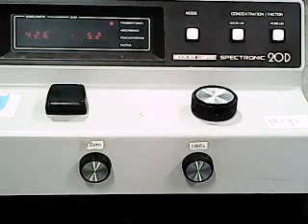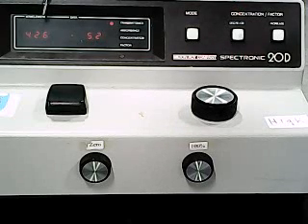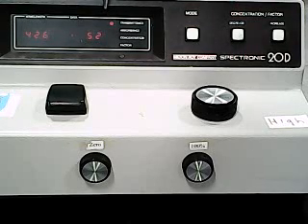What we have here is a spectrophotometer. This one happens to be what is known as a Spec 20D. And it has several parts. On the top left side, we have the screen. The screen reads the wavelength the spectrometer is looking at in nanometers. So this one is presently looking at the wavelength of 426 nanometers. Next to it, we have the instrument reading.